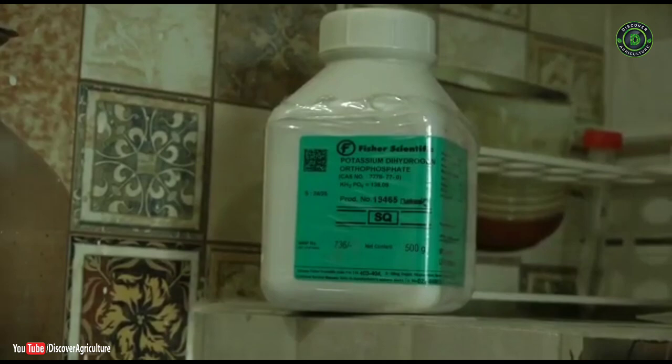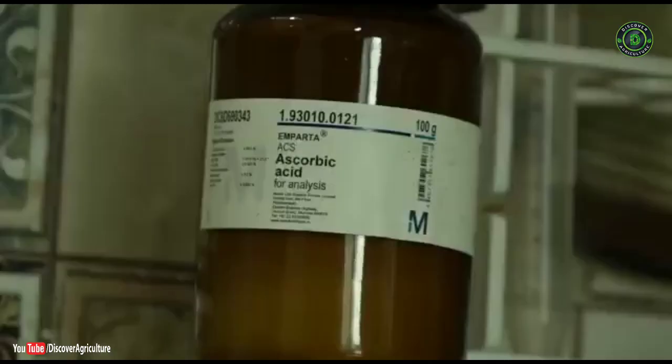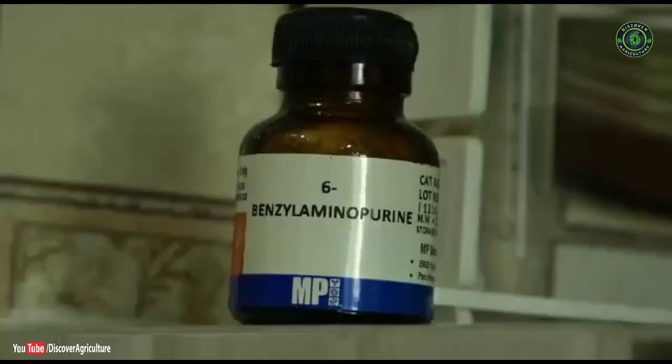MS media with modification is widely used for banana tissue culture. MS media has four basic components: macronutrients, micronutrients, vitamins and hormones, and carbon source.